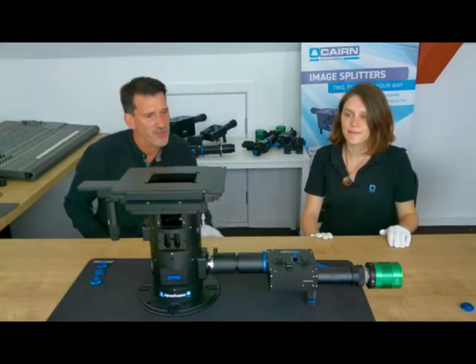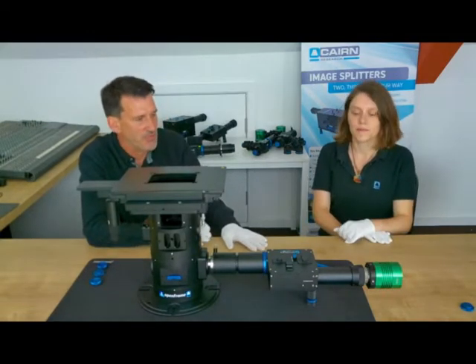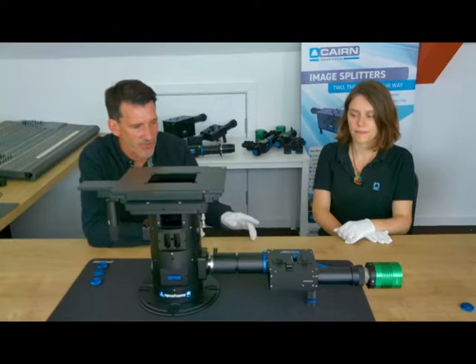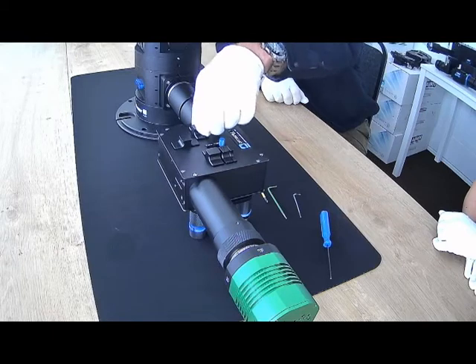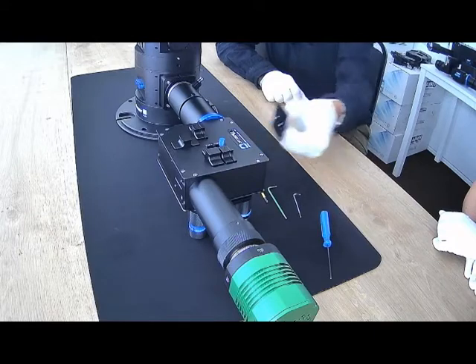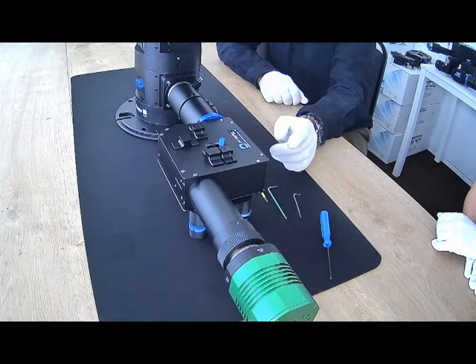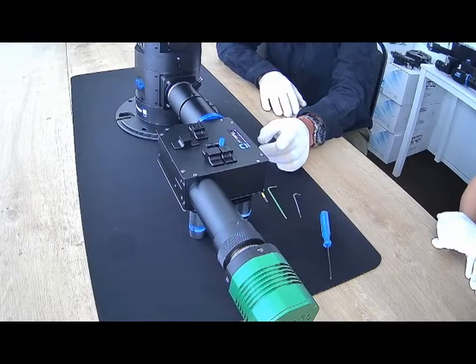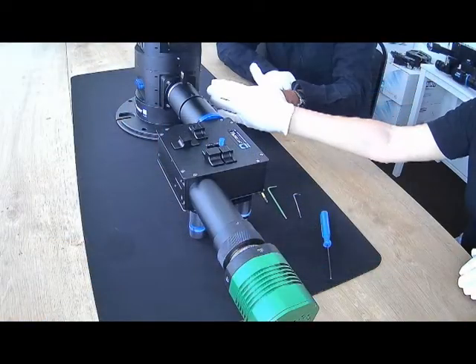So, starting with the OptiSplit 2 bypass, hopefully some of you will be familiar with this. It's an image splitter designed to do simultaneous 2-colour imaging on a single camera sensor. It has a very neat, convenient bypass mode, has individual filter positions for adding filters over and above filters that are incorporated into the fluorescence cube. This one is configured with a C-mount camera, but we support larger formats and can fit T or F mount, or even dedicated mounts for bespoke cameras such as the Photometrics Kinetix. And that's the same on both the input, that can be configured C-mount, F-mount or T-mount.